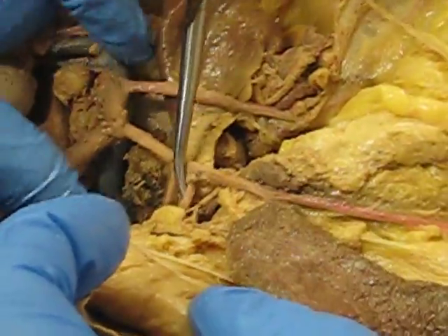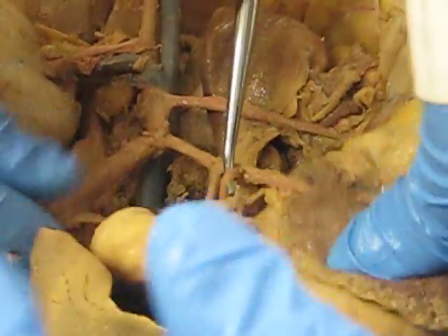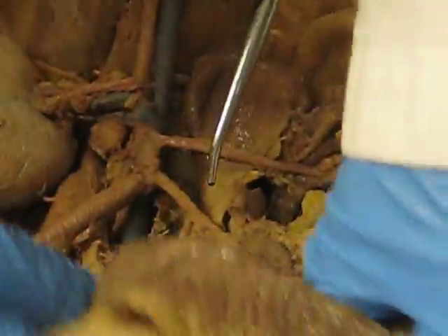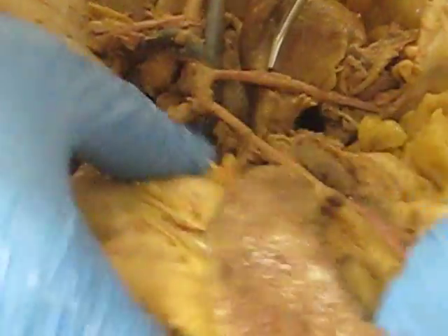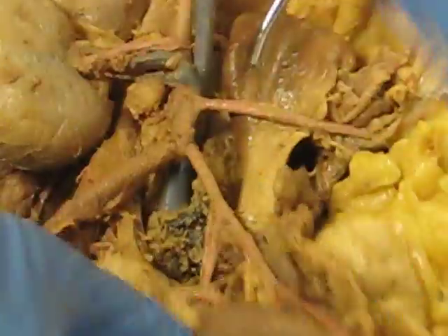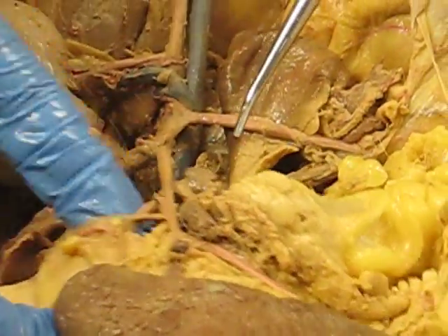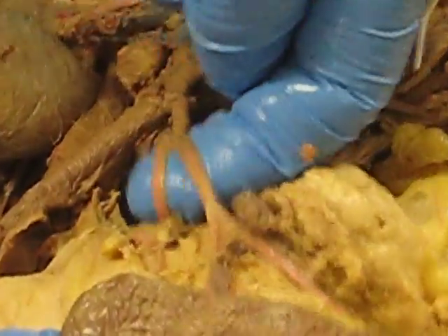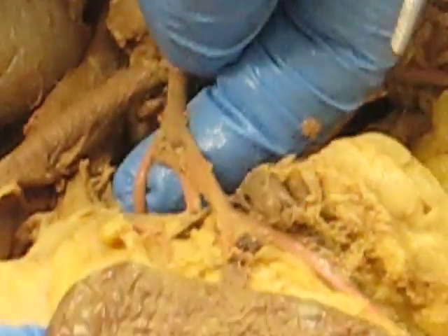Then the left gastric, which is the middle one — it is going to the stomach. The middle one is the left gastric artery. And then the last one is the hepatic artery.